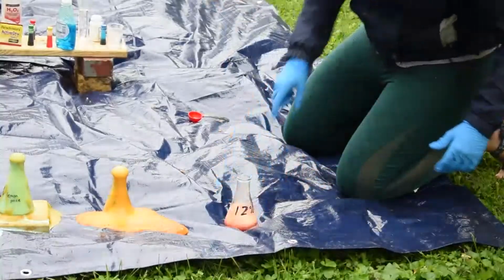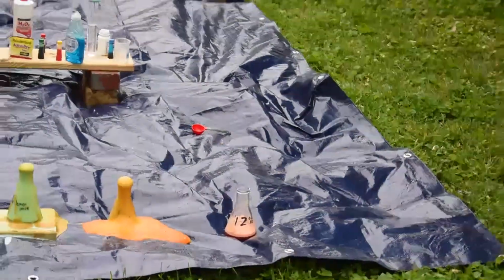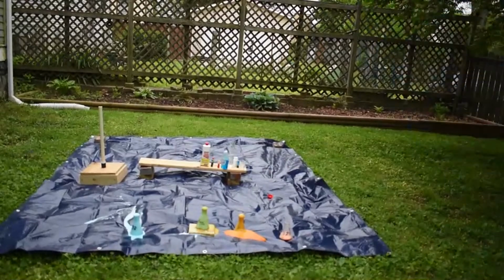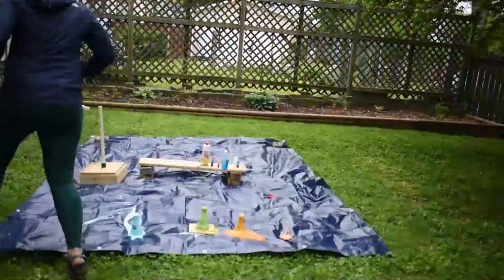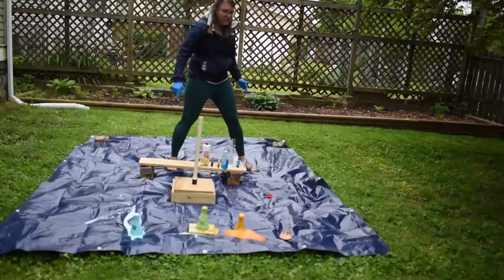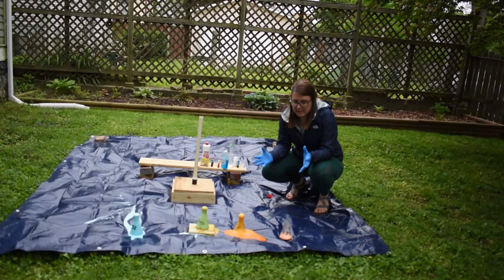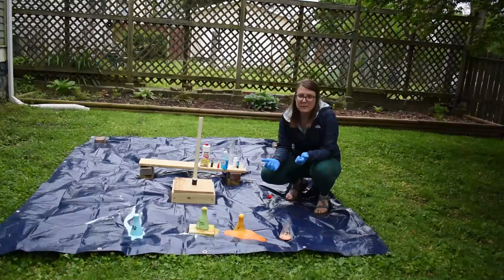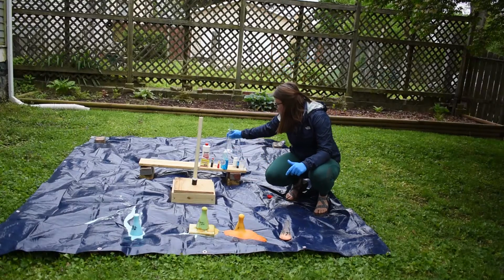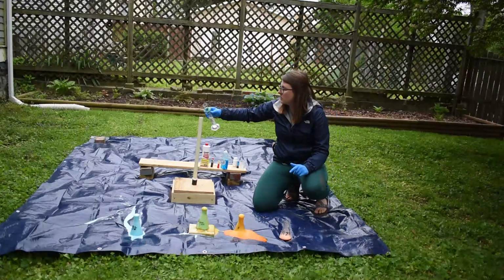But in the meantime, I have a setup back here that you can probably see. This is just a piece of PVC pipe. I figured we would take the amount of space that it has to react and concentrate that so the reaction goes a little more vertically. I have in this graduated cylinder 60 milliliters of hydrogen peroxide, so I'm going to pour that in here.